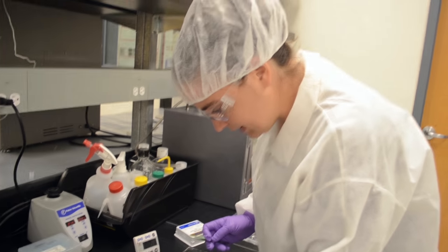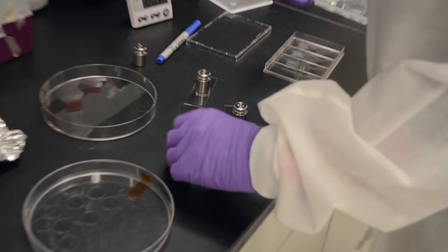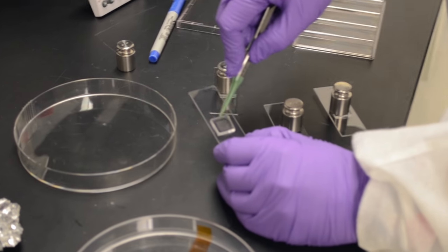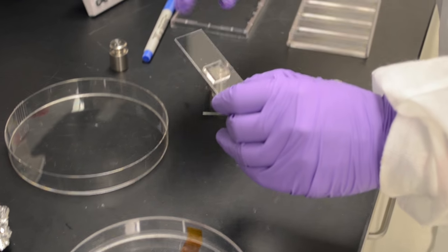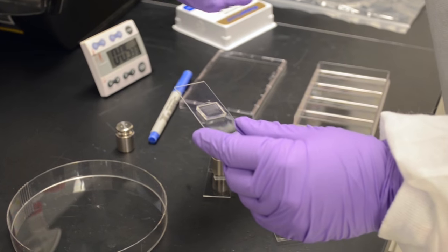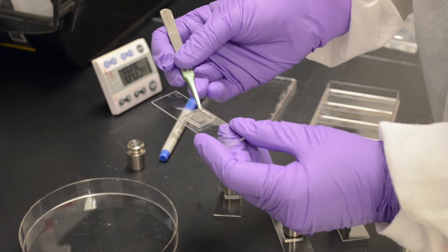So basically what you do is take the weight off, and then you can see kind of where the border is still attached, but you see the square? The reason it looks like it's not attached to the glass is because there are little raised grooves there. So hopefully the tops of those grooves did attach or contact.